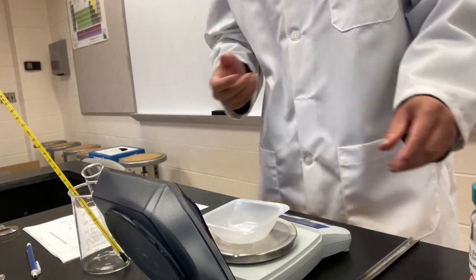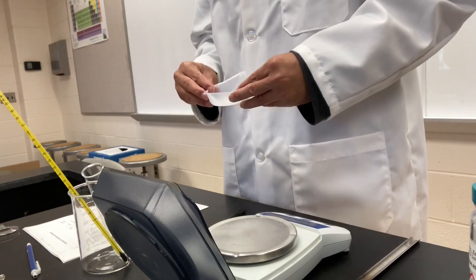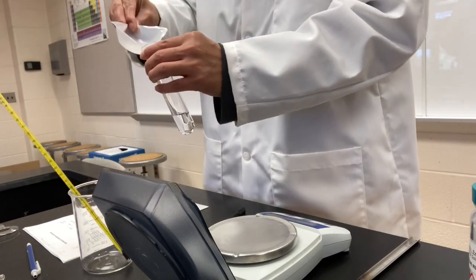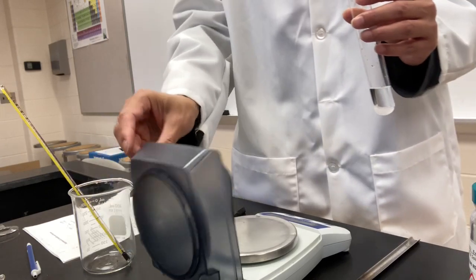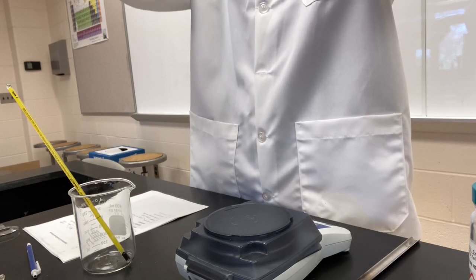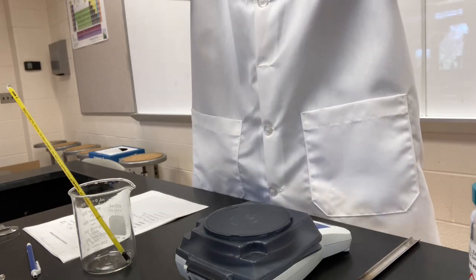2.183 grams. Take a record. The one we just added was 2.385. Now we add another 2.183 grams. I keep doing the same thing like I did for the first addition. We'll give it a little more time, maybe this time even longer than 5 minutes. We'll see.